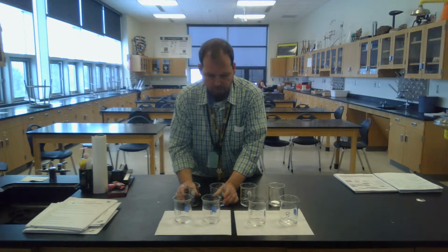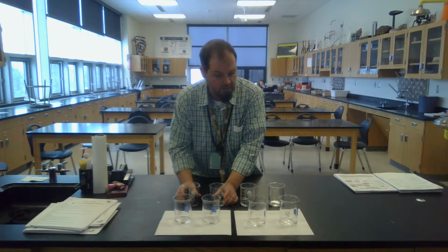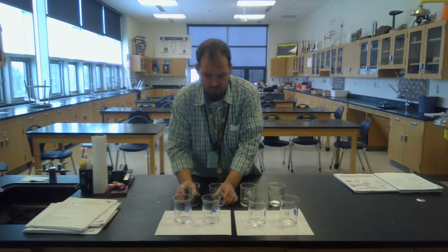So ready? I'm going to pour these and pour these. We'll see the reaction. You will, of course, pour these all at the same time because you'll have four hands. This is why I don't want just two people or even more than two people. I want all four of you involved. Ready? So let us just do the reaction, then I'll talk you through the lab.